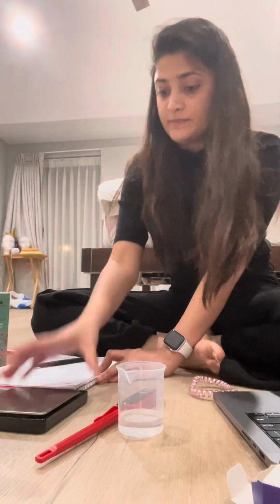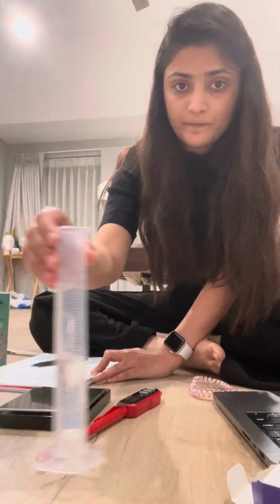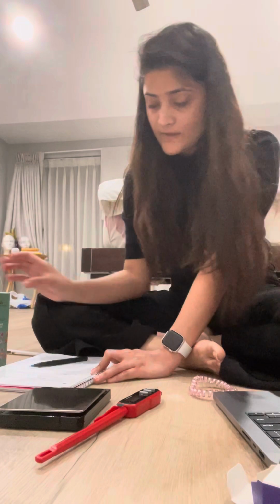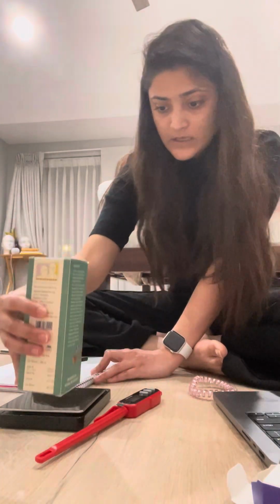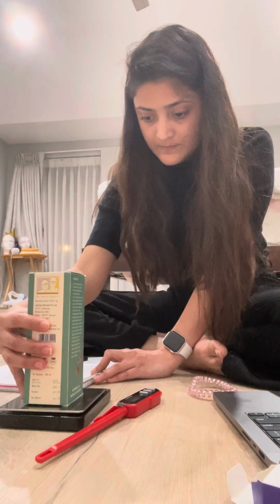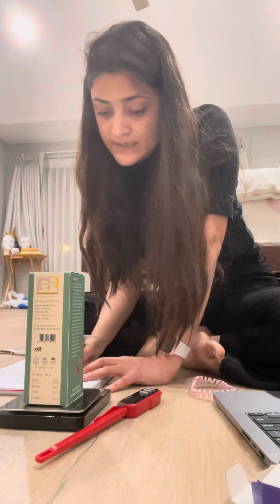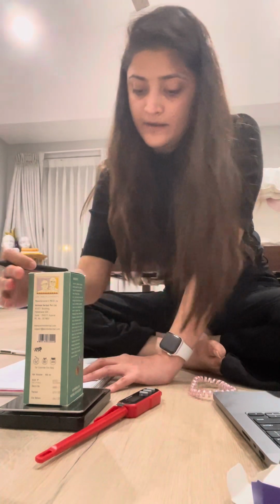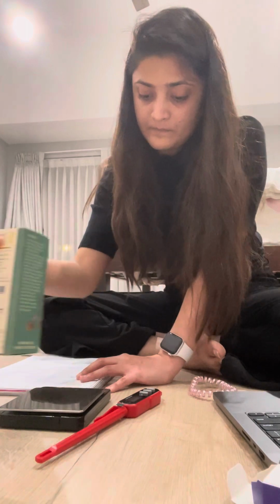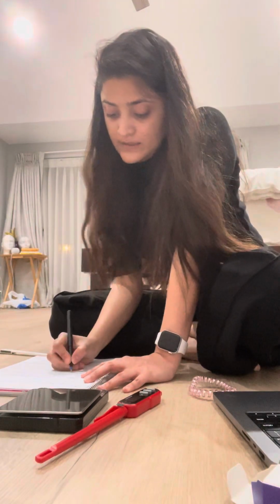I'm going to place this onto the scale. All right, so it says 49.99. All right, and that was in grams.